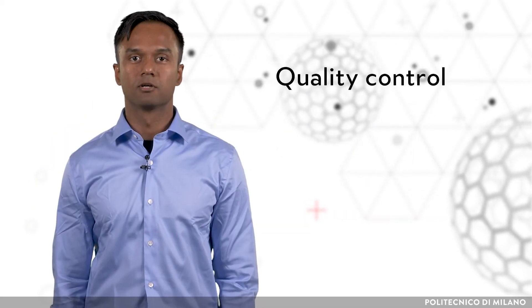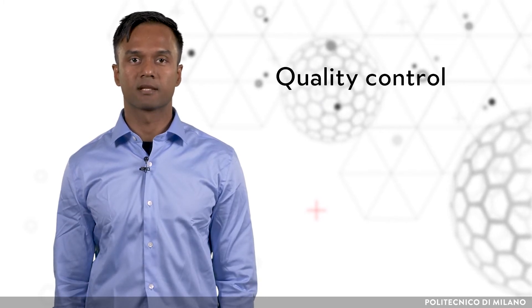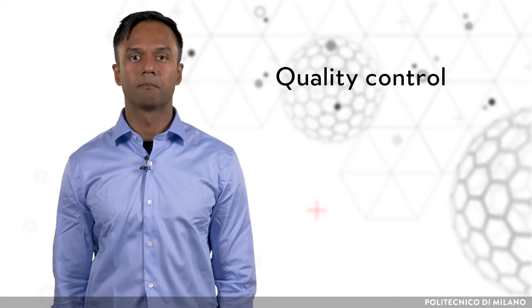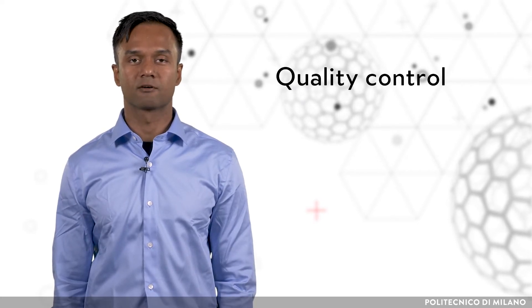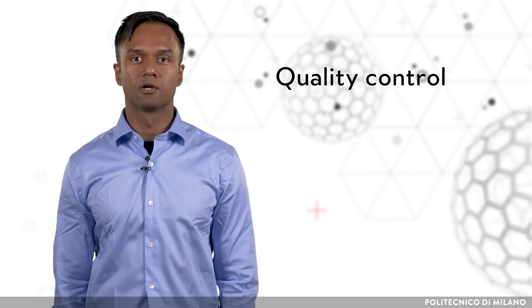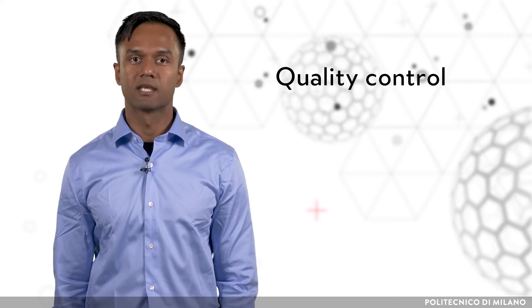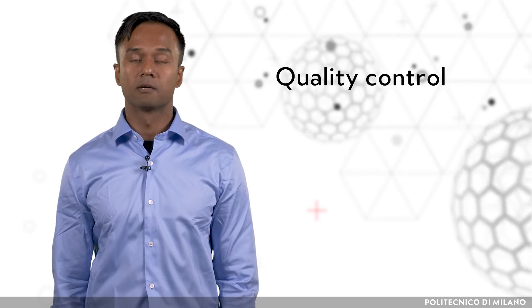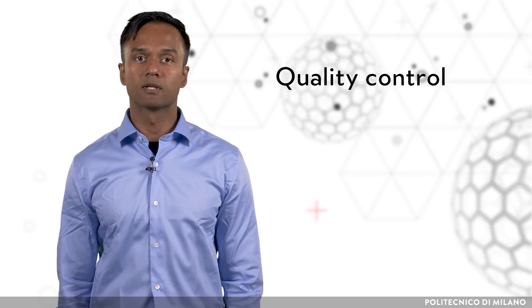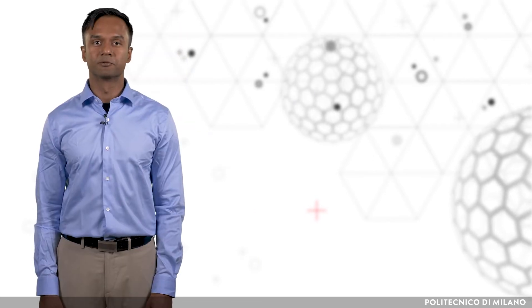After purification, quality control takes place. This involves several specific tests and measurements that ensure the characterization, purity, biological safety, and efficacy of the radiotracers. The quality control tests used for radiotracers not only include those for typical radiopharmaceuticals, such as determining the pH, osmolality, and ionic strength, but also tests for radionuclidic and radiochemical purity.